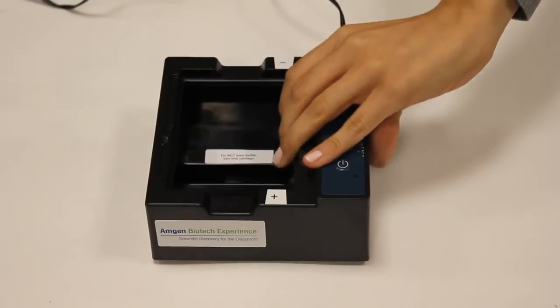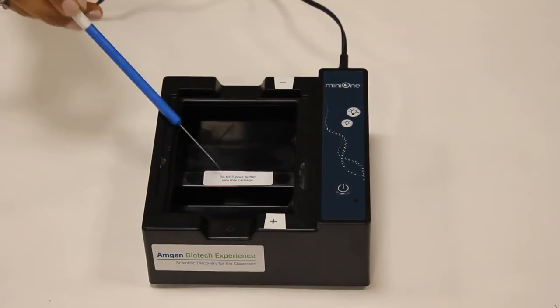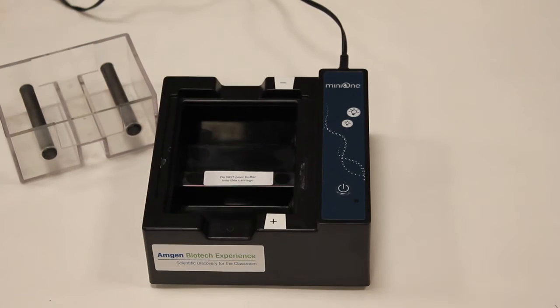Please remember that you cannot pour buffer in the base. Buffer must be poured in the electrophoresis chamber because there are two electrodes that are within the base that may get destroyed.